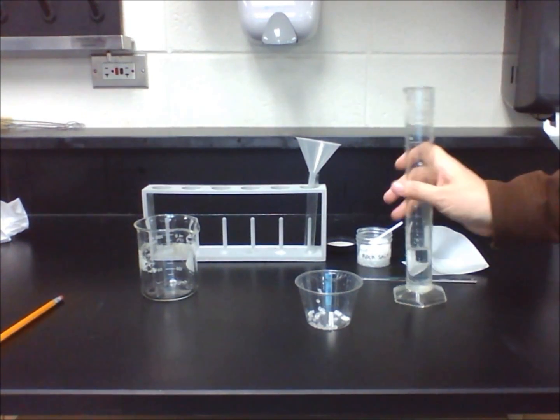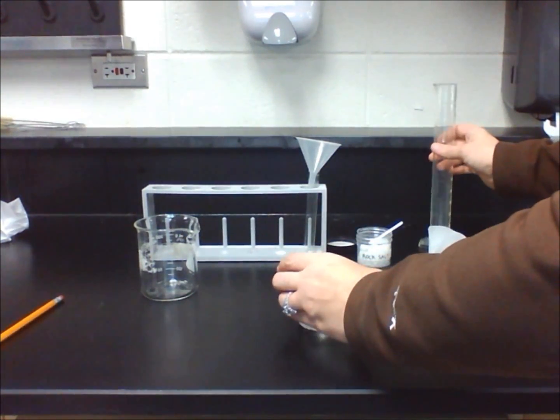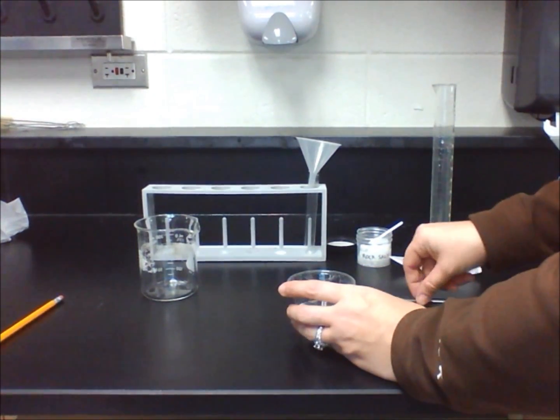First, pour 25 milliliters of water into a cup. Put two lab scoops of rock salt into the water and stir until dissolved.